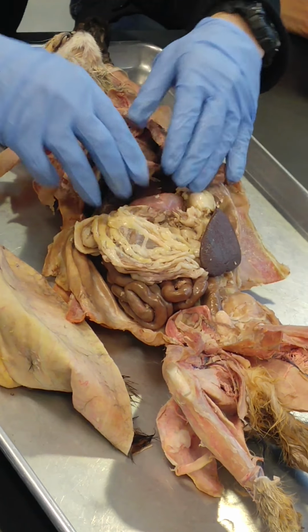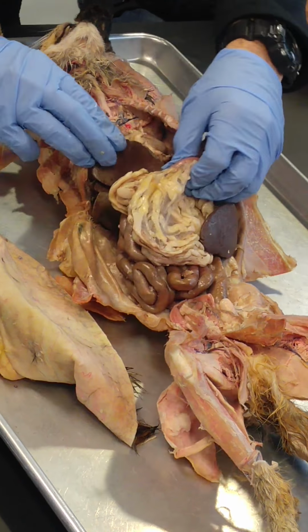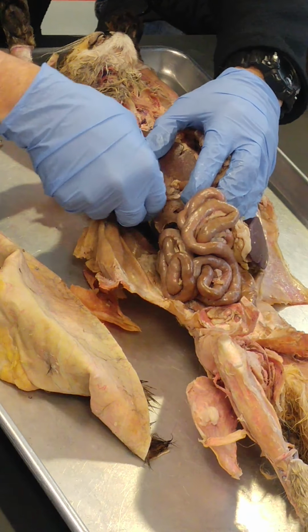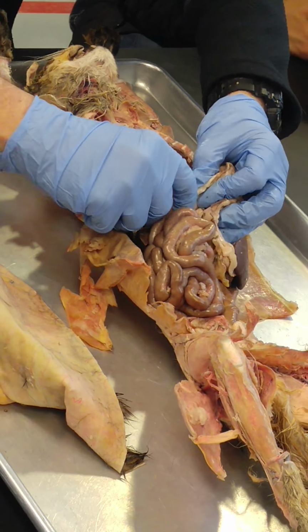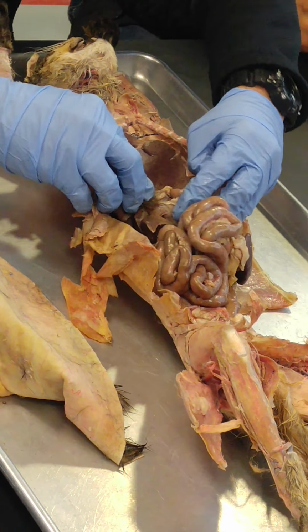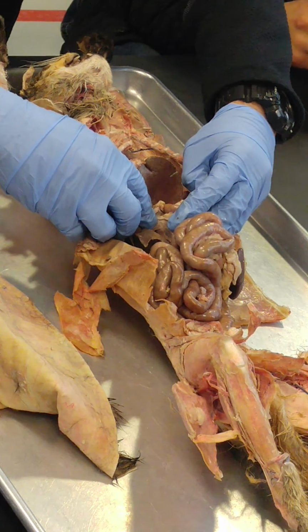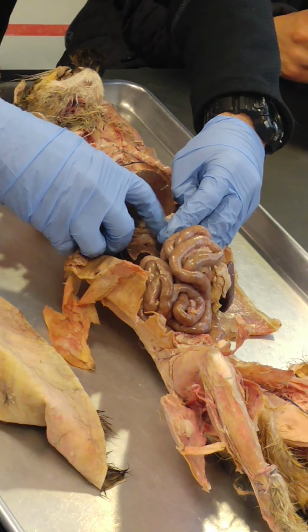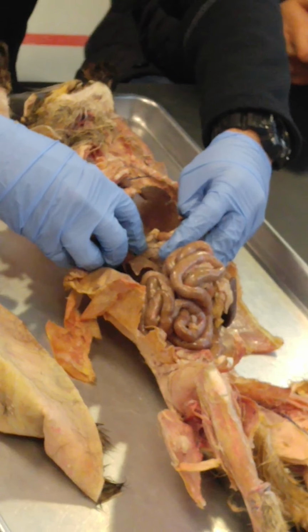Common bile duct. We're probably not going to see that, but because it's all still connected in here, if you look very carefully, you can see it going from the gallbladder down into the duodenum. That green thing there is going to be the common bile duct, but I won't have you know that on the cat. We might have you know it on a diagram. It's going to go from the liver down into the duodenum.